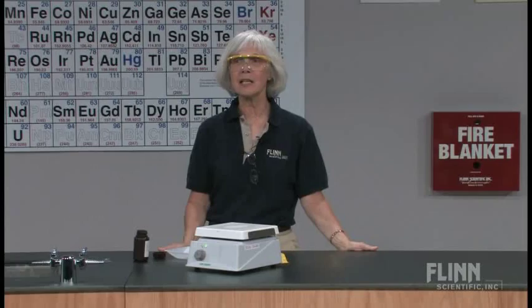This next demonstration is one that I do with my second year advanced chemistry class when I'm talking about crystal structures, but I've also used it in my first year class when I've introduced electrons and light. It also has application in food chemistry and in nuclear chemistry, as we'll see later when I discuss the experiment.